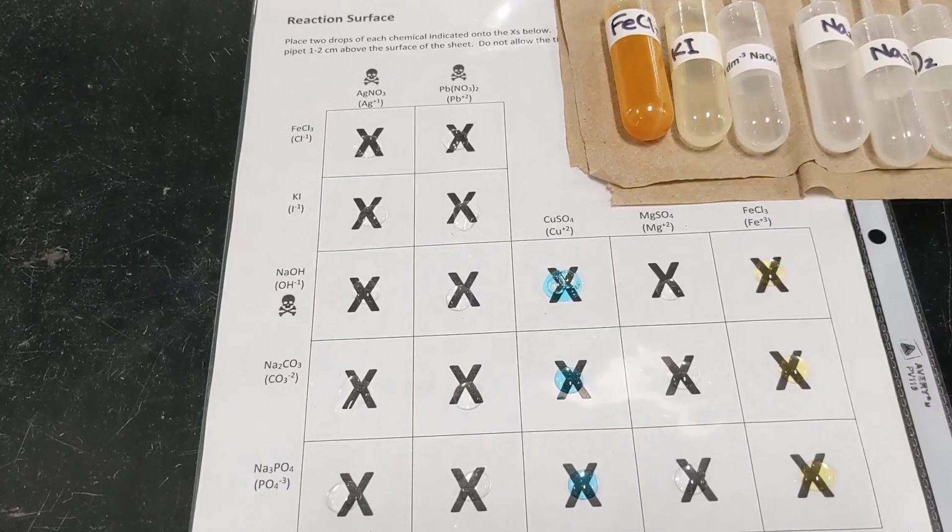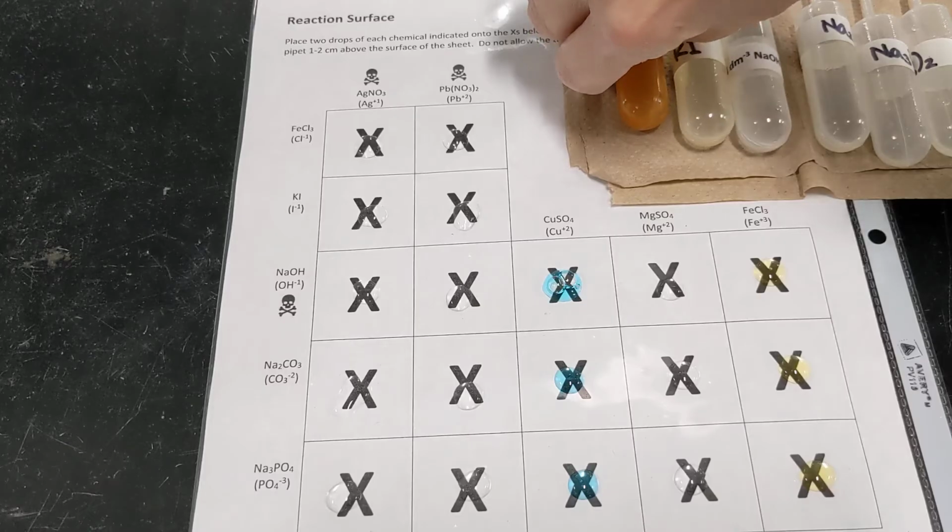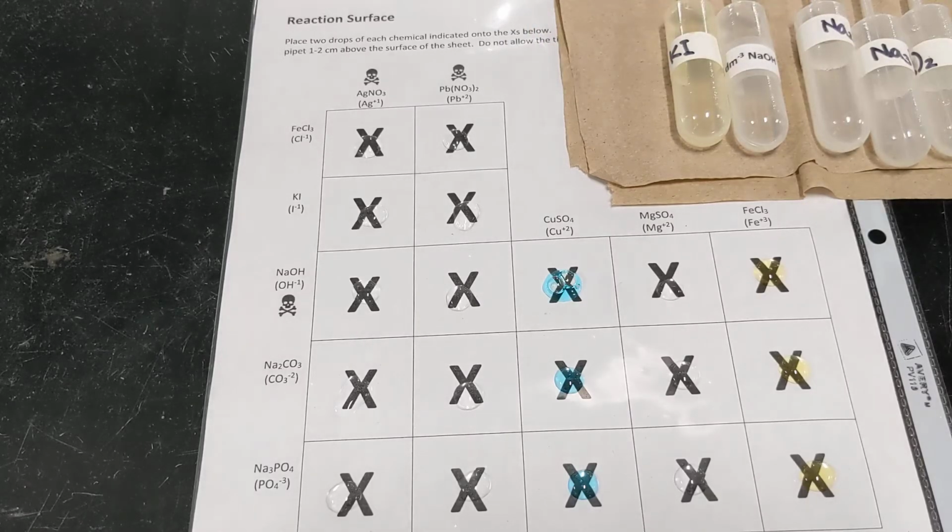Right? When that happens, we are seeing the formation of a precipitate, and that is a solid that's forming in that solution, and that solid is forming because it's making a new ionic compound. So that's what we're going to be looking for here, any precipitates that we can see forming. And then we will be writing in the first, at the top of our box for each, on our corresponding data table, what we see. So precipitate's kind of a long word to write, so we can use the abbreviation PPT when we see that.